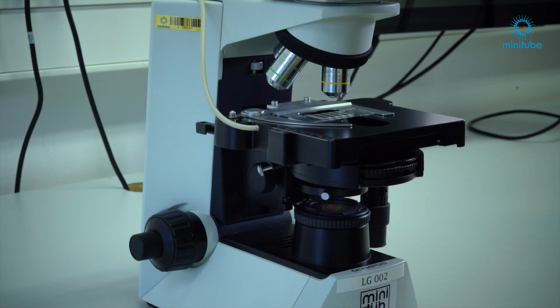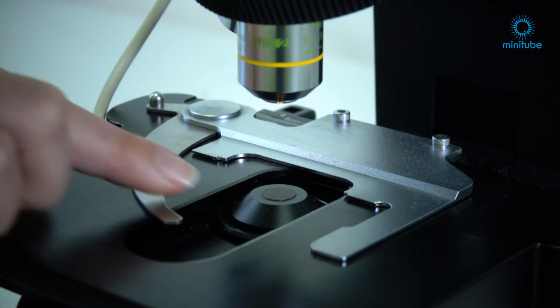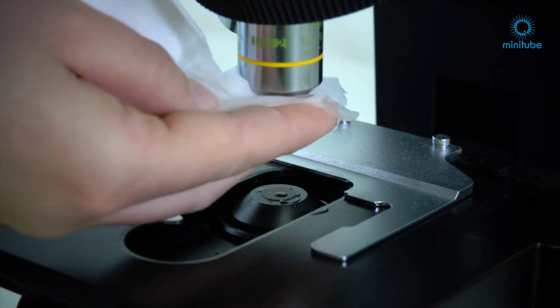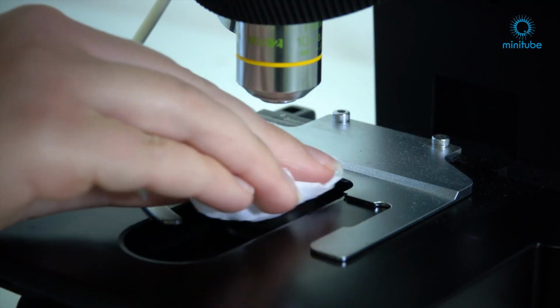What to do when the microscope has been adjusted properly, but the picture still appears grayish and unfocused? Please clean the objective lens as well as the condenser lens. Especially extender residues can affect the picture. Please clean first with a microscope tissue and hot water to dissolve the sugar contained in the extender, and next with a microscope tissue with alcohol for a clear picture.